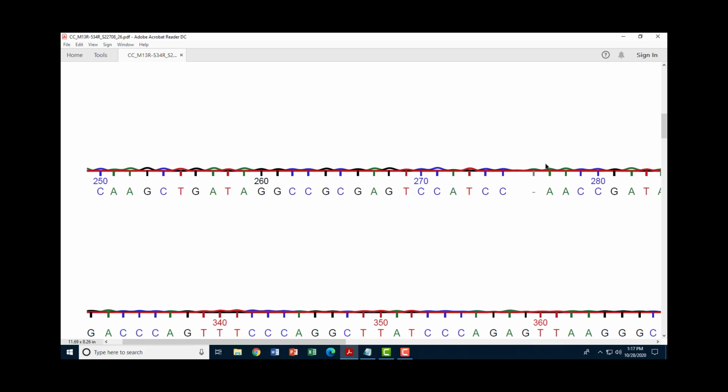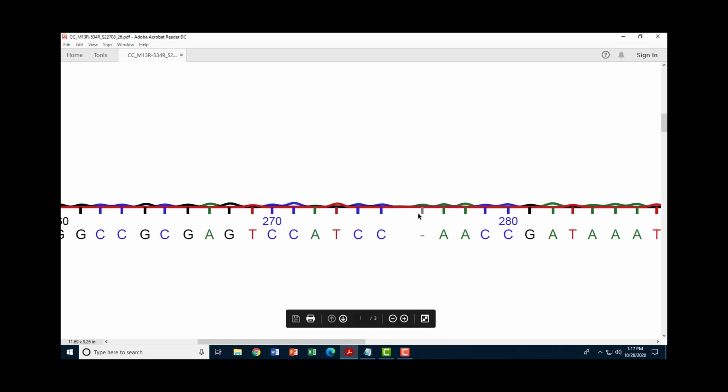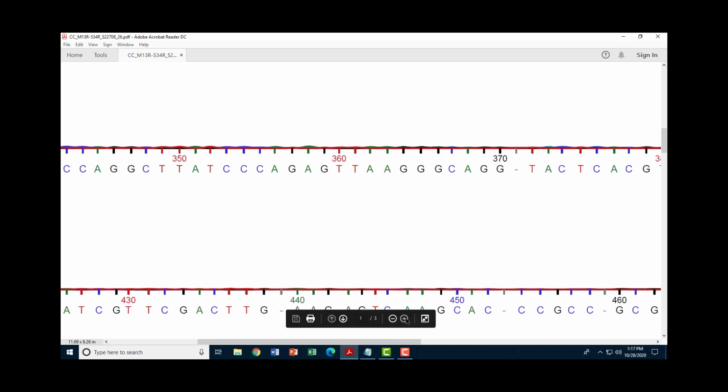But if we go back to this data and look at it, and we look more closely at what's going on here, we can see that there's a little green peak right here. Now, it may be masking another peak, it may be masking the blue, and maybe we can't see it, but it looks a lot like what's going on here and here. And so what I would do, if I'm trying to clean up my sequence, is I would look at this peak, and I would call that adenine, and I would insert A into this position in my text file. Then I would go on and look for other places like right here. Let's see if it's possible to look at anything there.